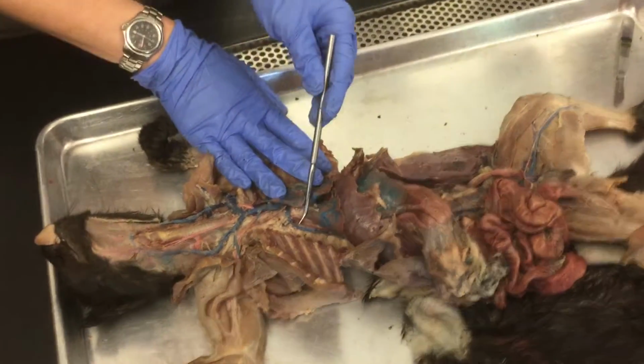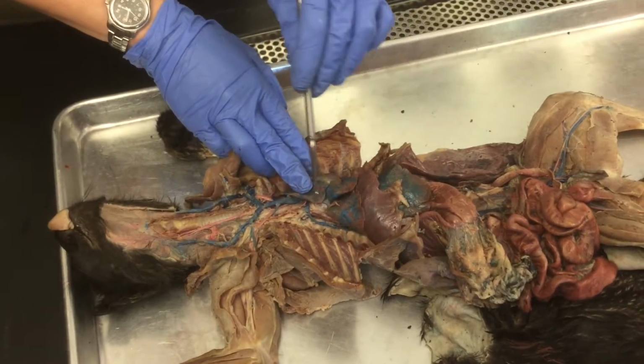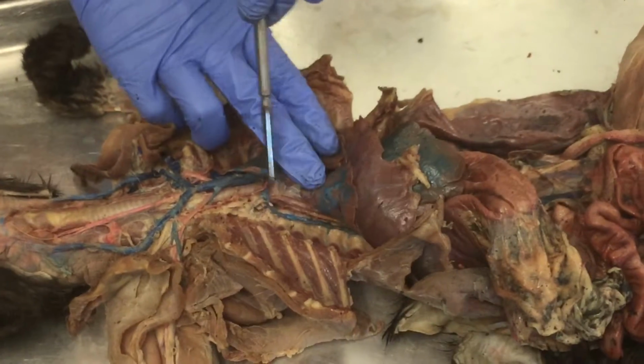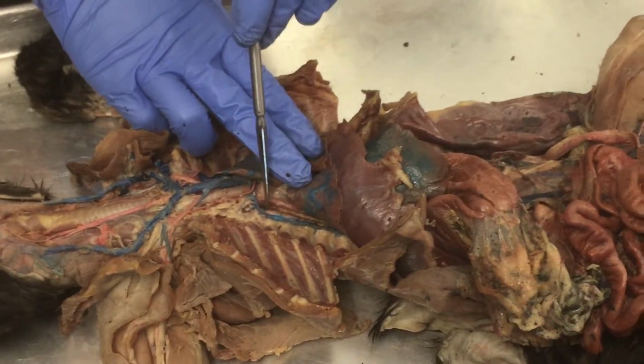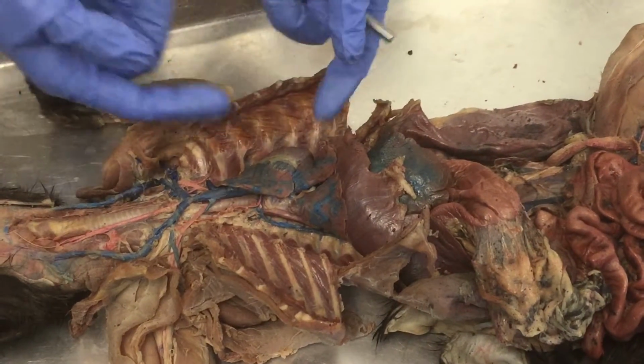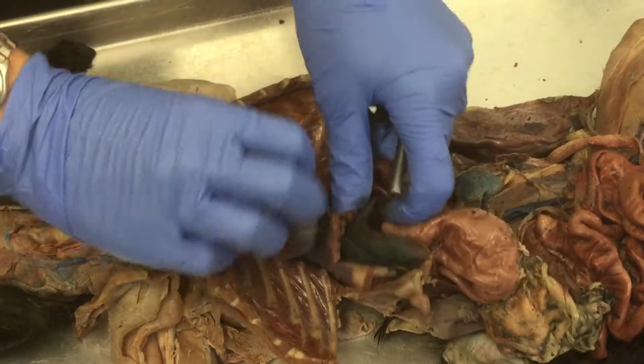On the right-hand side is a azygos, okay? The azygos is going to branch off of the SVC and go down into the thorax. I just want you to clear off a little bit for me. So just identify it for me, and that's on the right side only, okay? Everything else is going to be on the left.